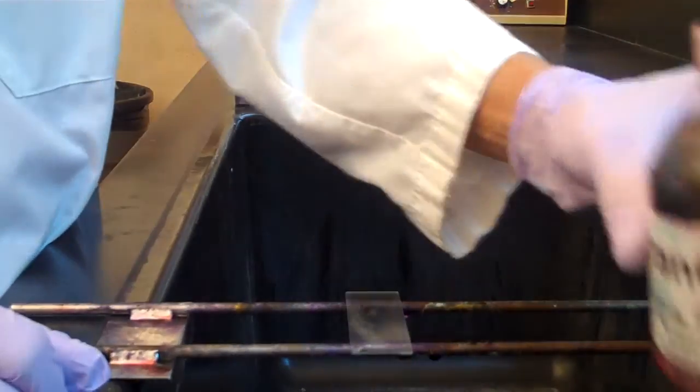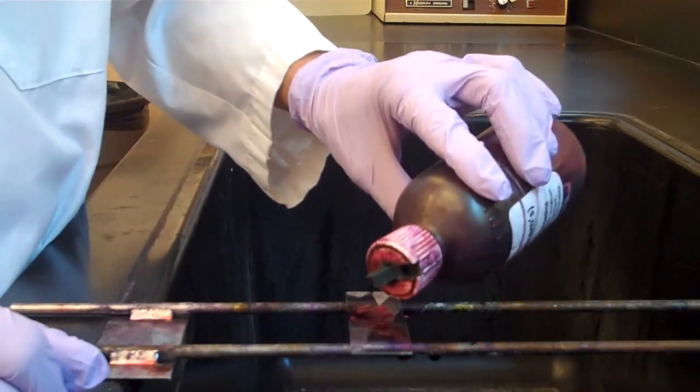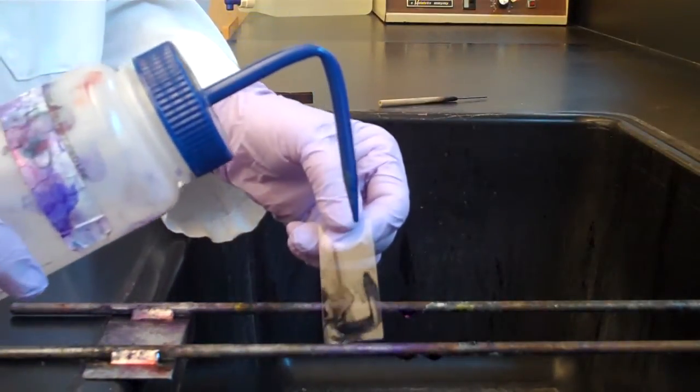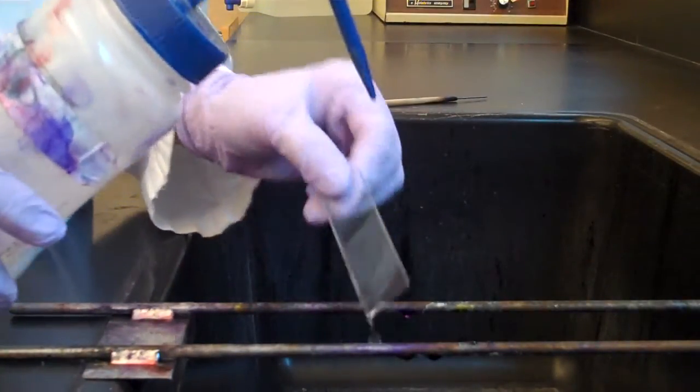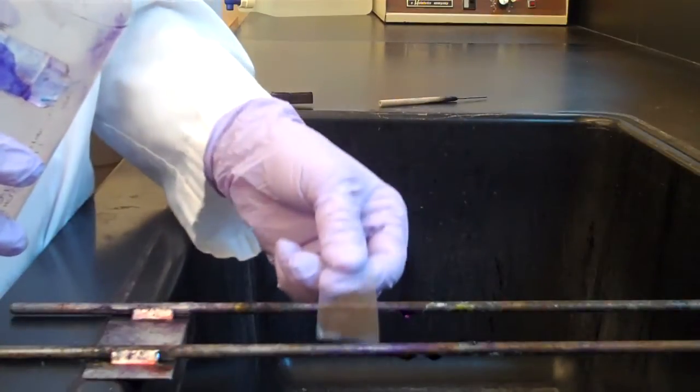Puddle safranin on the smear. Wait one minute. Rinse the slide with deionized water and shake excess water from the slide.